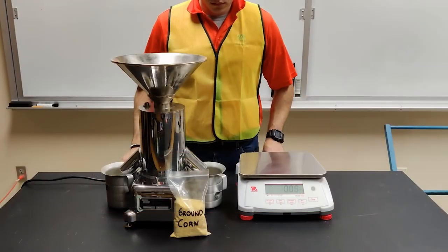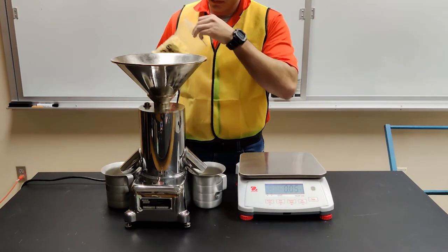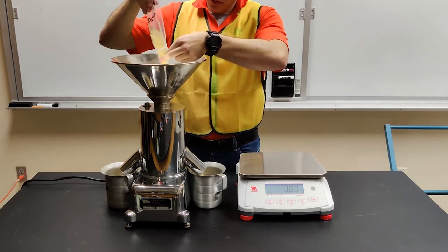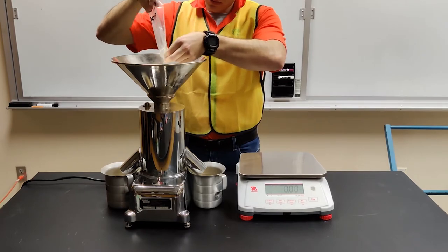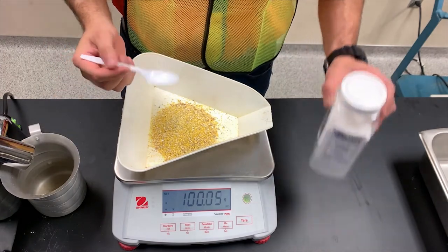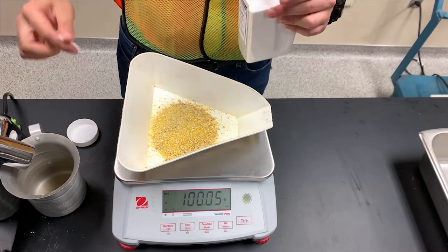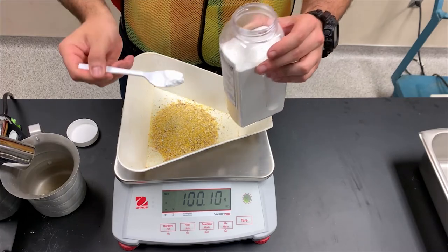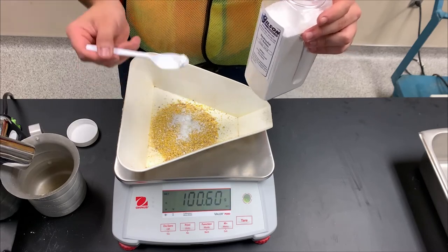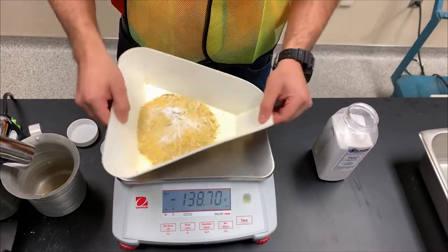The next step is to divide the sample and weigh 100 grams using a scale with ±0.1 grams of accuracy. A 100-gram sample is recommended to avoid accumulation of more than 20 grams over any one sieve, which can prevent particles from moving to a lower sieve. Place the 100-gram sample into the tray. Now add 0.5 grams of sieving agent to prevent particle agglomeration, particularly in ingredients or feeds with a high fat content. After adding the sieving agent, mix the sample and sieving agent gently to distribute the sieving agent homogeneously in the sample.